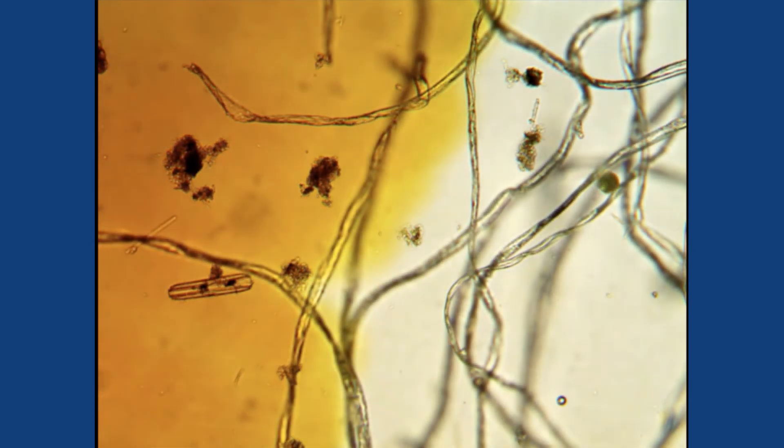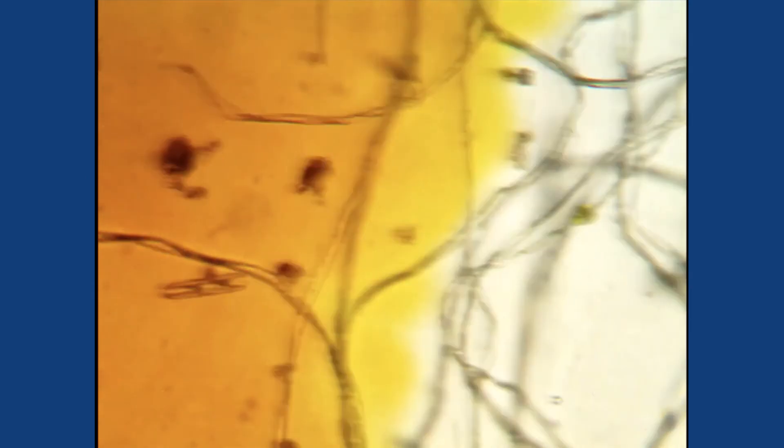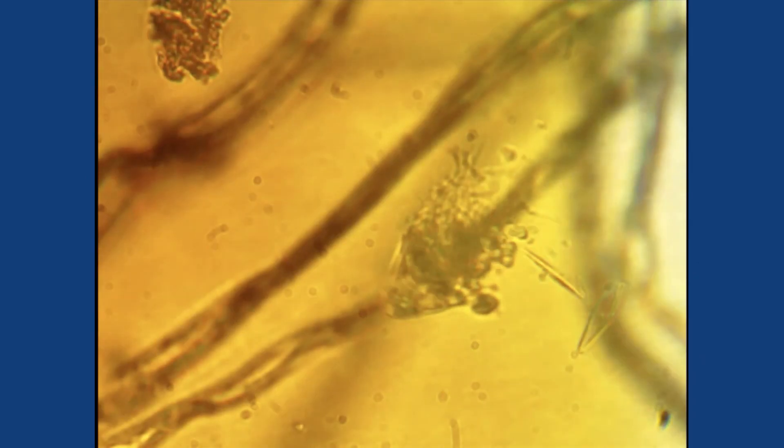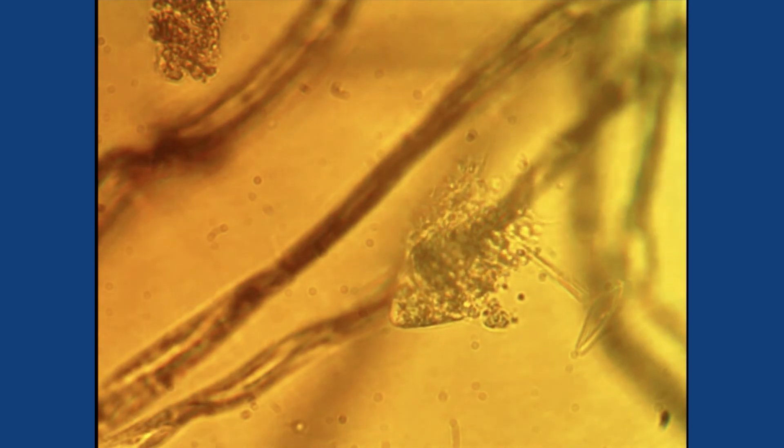If the movement you were looking at continues, it was Brownian motion. If it stops, then it was motility and the organism that you were looking at just died.